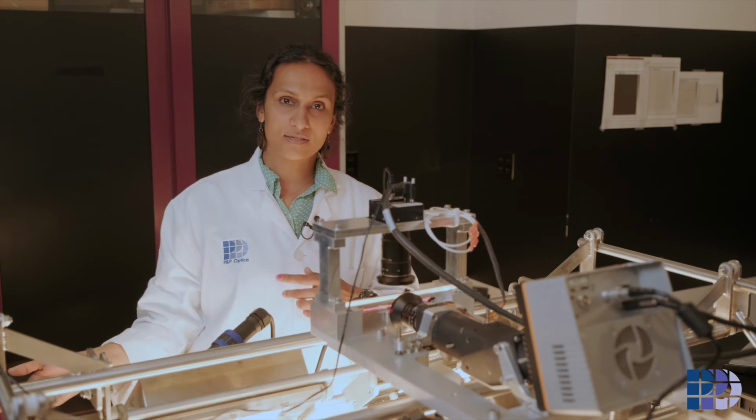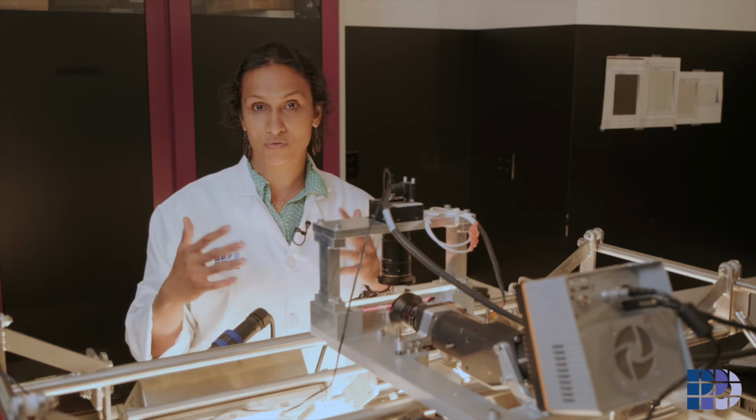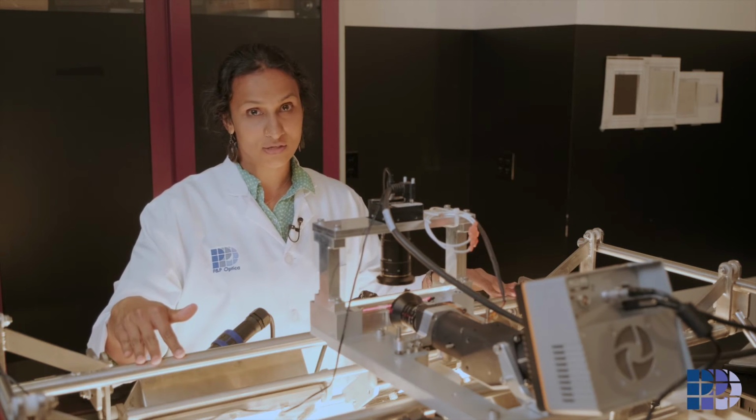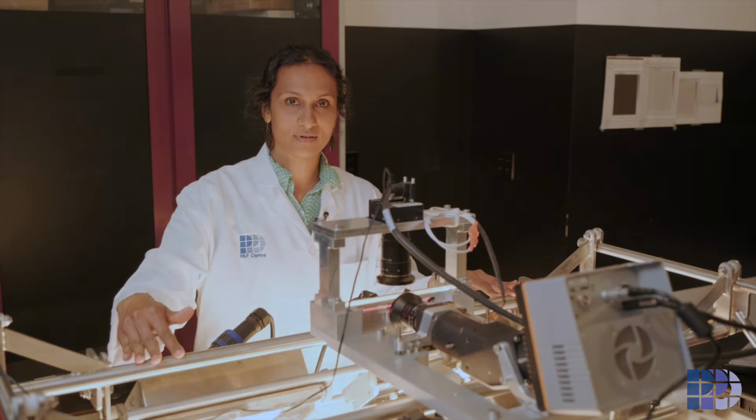So Danielle is going to show us how the lamps are put together and how it's going to come back here and how we run our calibration. So on to Danielle from here.